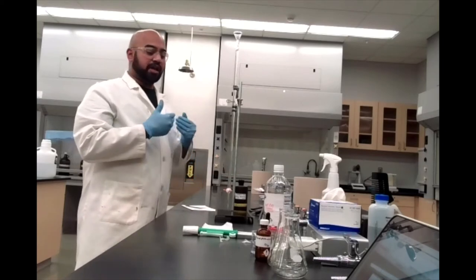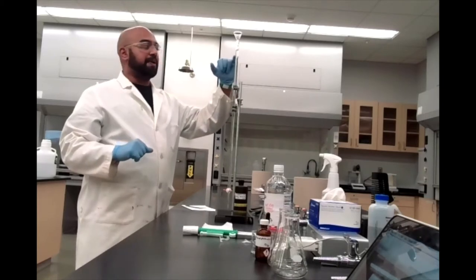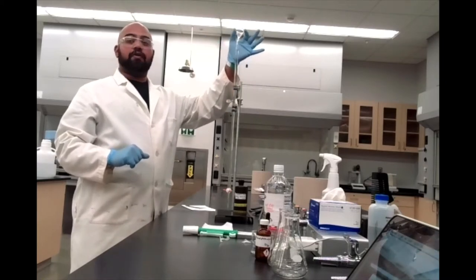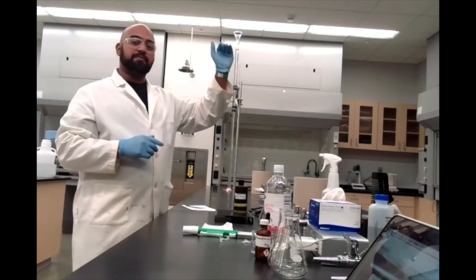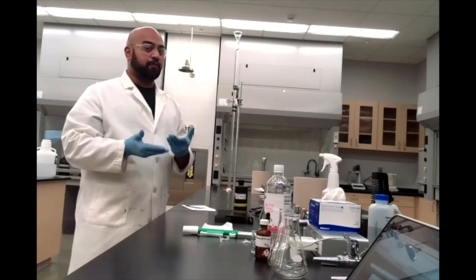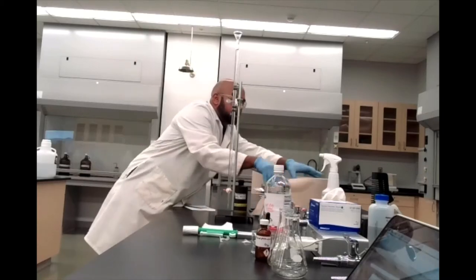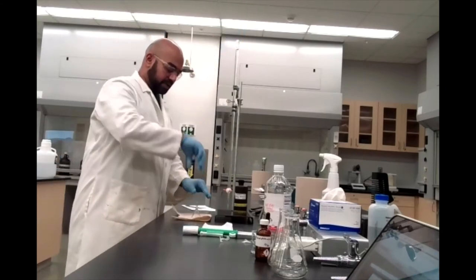Now a couple of things to note regarding our setup. I've gone past the zero marking on my burette. Before I do any readings, I want to take off the burette funnel — you don't want to leave this on during your titration. Sometimes sodium hydroxide sticks to your funnel and might drip into your burette after you've made a reading, meaning you have more sodium hydroxide in there than you think, which affects your results.